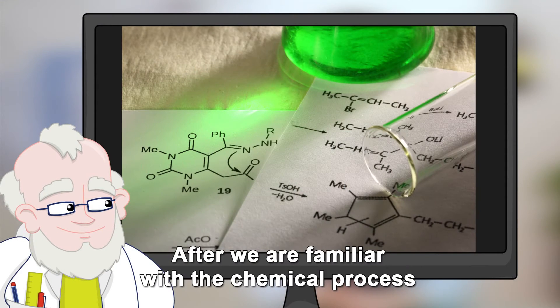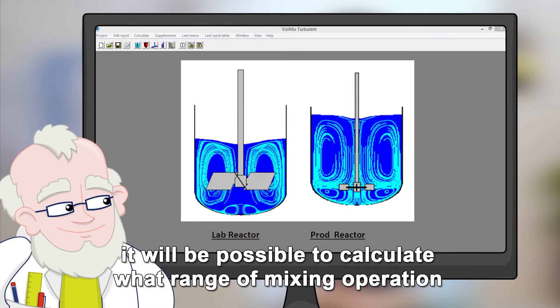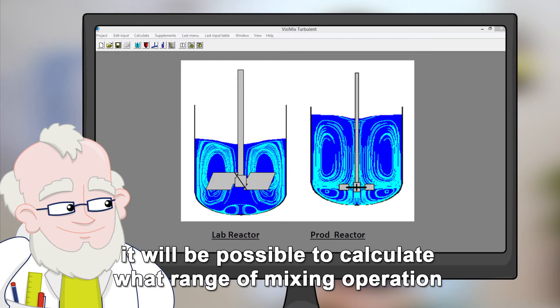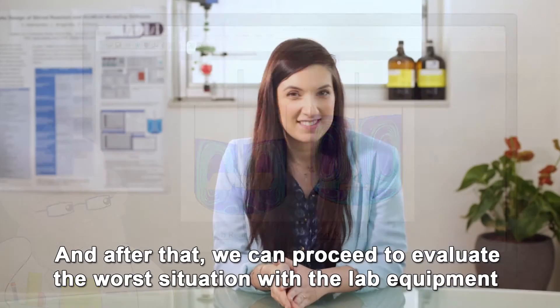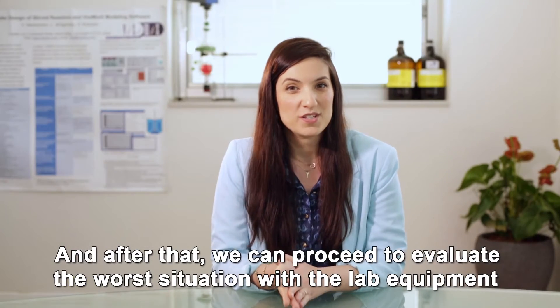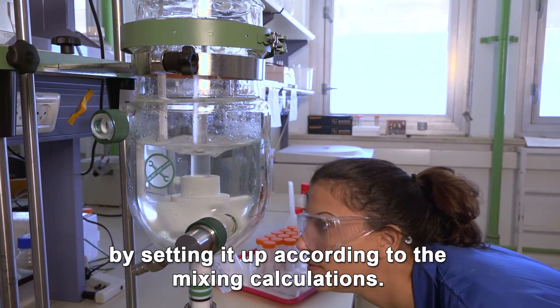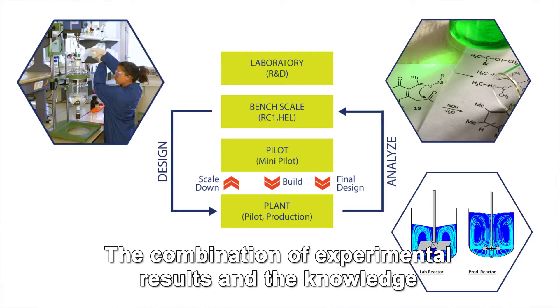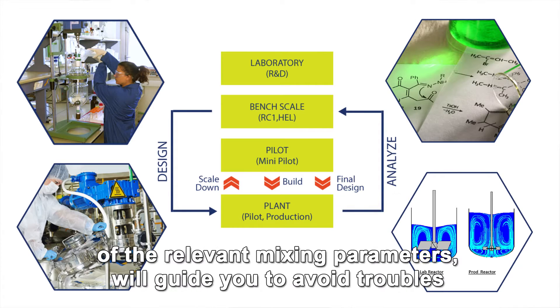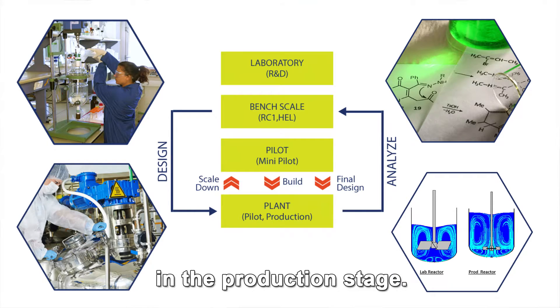After we are familiar with the chemical process and the product quantity as defined, it will be possible to calculate what range of mixing operation and conditions are required in the production stage, and after that we can proceed to evaluate the worst situation with the lab equipment by setting it up according to the mixing calculations. The combination of experimental results and the knowledge of the relevant mixing parameters will guide you to avoid troubles in the production stage.